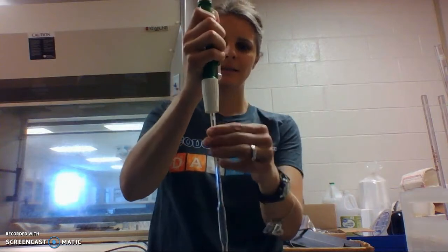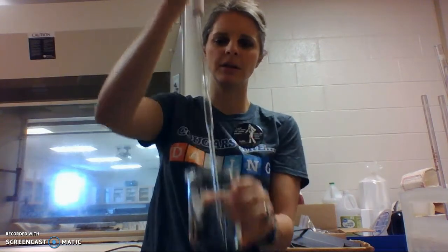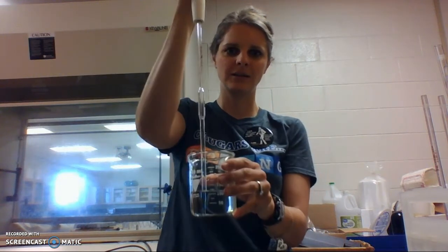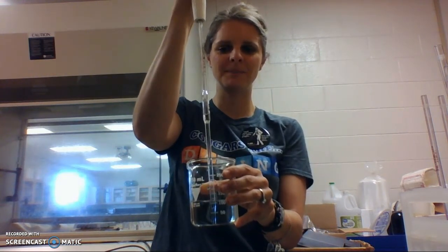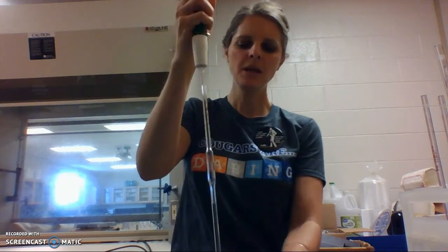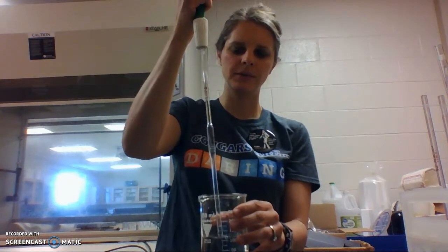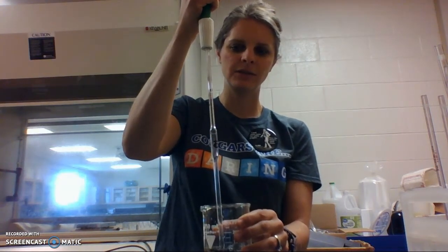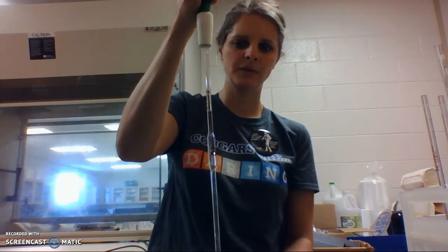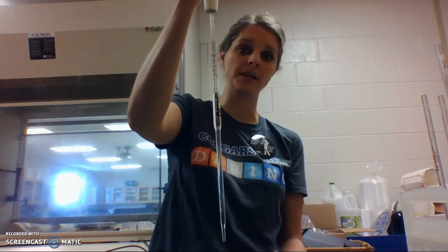We're going to stick it into the solution, in a beaker here, of just water, and we roll this right here, rolling this upward. And what it does is start to suck the water upward. I can release the water by pushing down on the button, or you can push this button too, and it'll release the water. So we have the pipette all the way in, roll it upward until you get to the line. You can be pretty exact. Most of the time you can hold it right at the line where you want it.